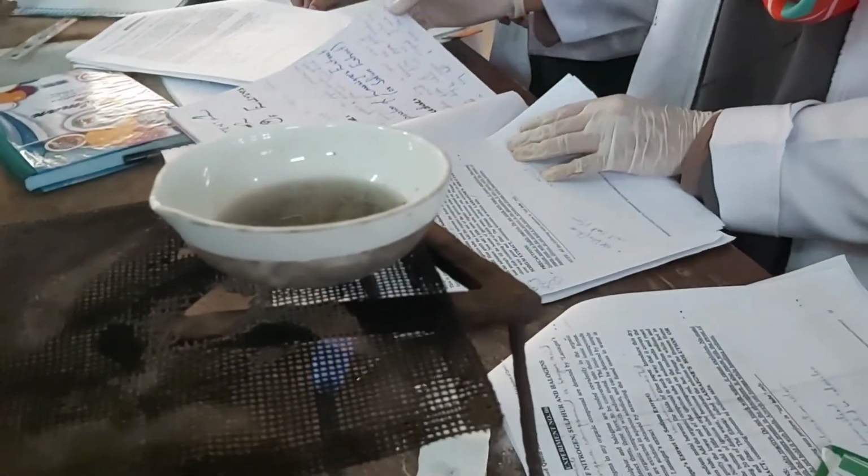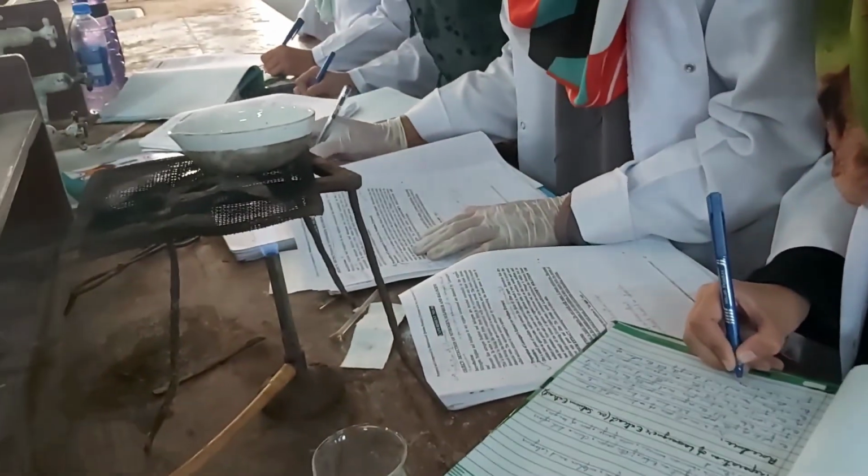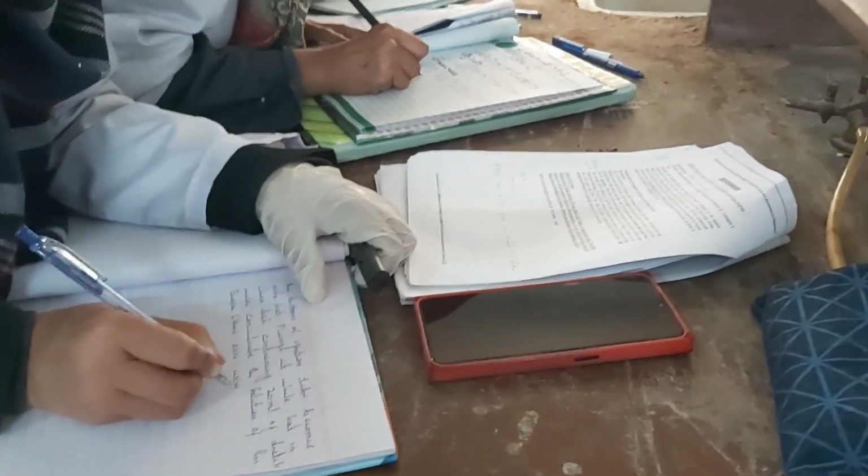My students are working, you can see them working over here. The girls are over there. I have given them the demonstration, and now they are doing the second part of the same compound, benzoic acid, that is, the detection of elements. The students are reducing the sodium extract to its half volume, and then they will proceed with the next reactions, that is, the tests for sulfur, nitrogen, and halogens.